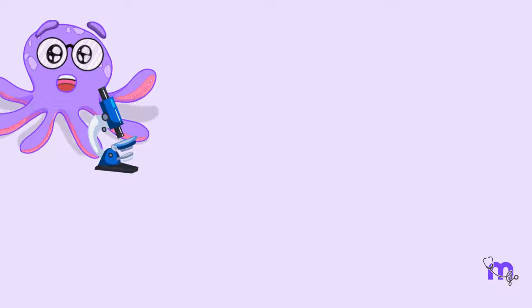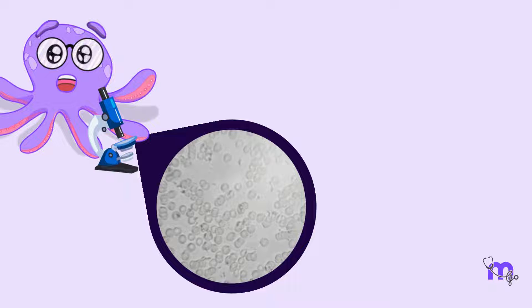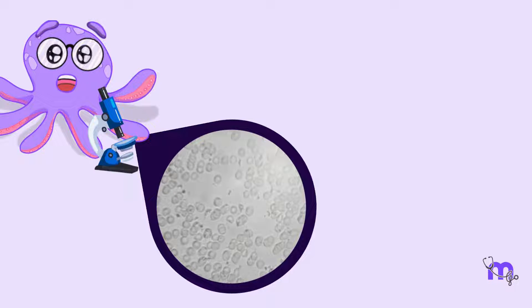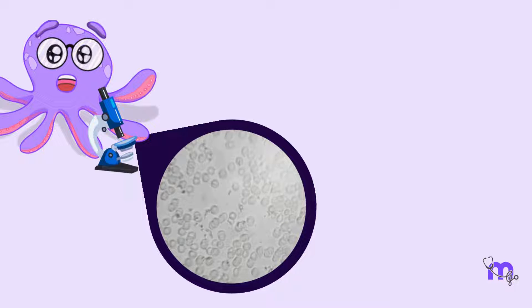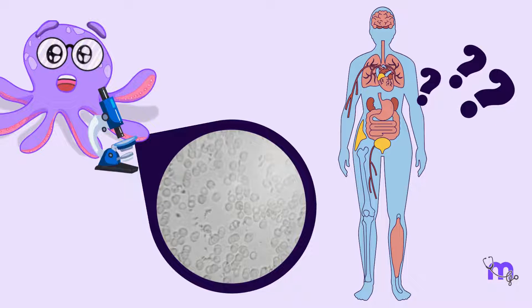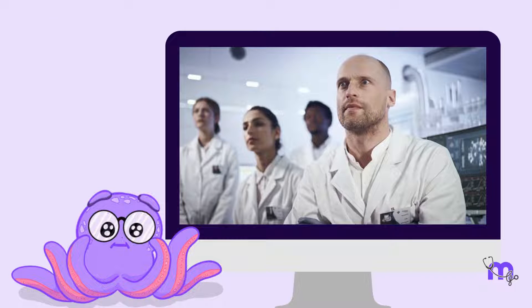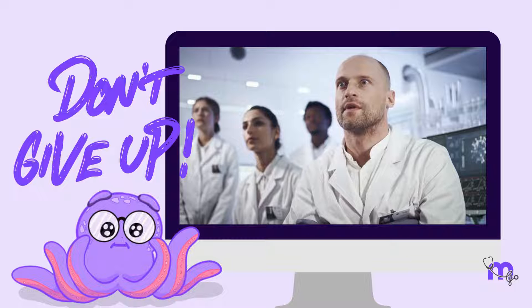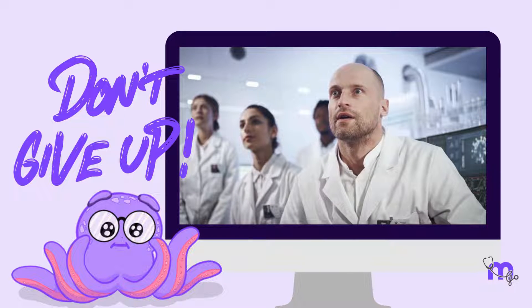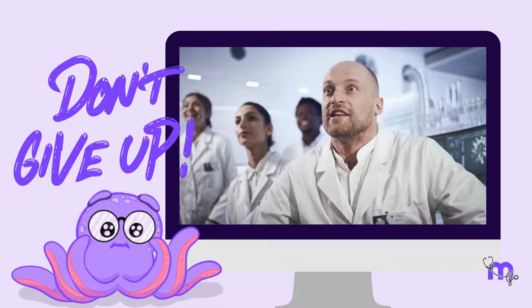With the invention of the microscope, scientists could finally see the microscopic world with their own eyes, but everything appeared colourless and incomprehensible. All the details of the human body were right there, but they were unable to understand them. However, these scientific explorers were not about to give up that easily. They set out on a quest to develop histological techniques that would allow them to peer even deeper into the cellular structure of the human body.